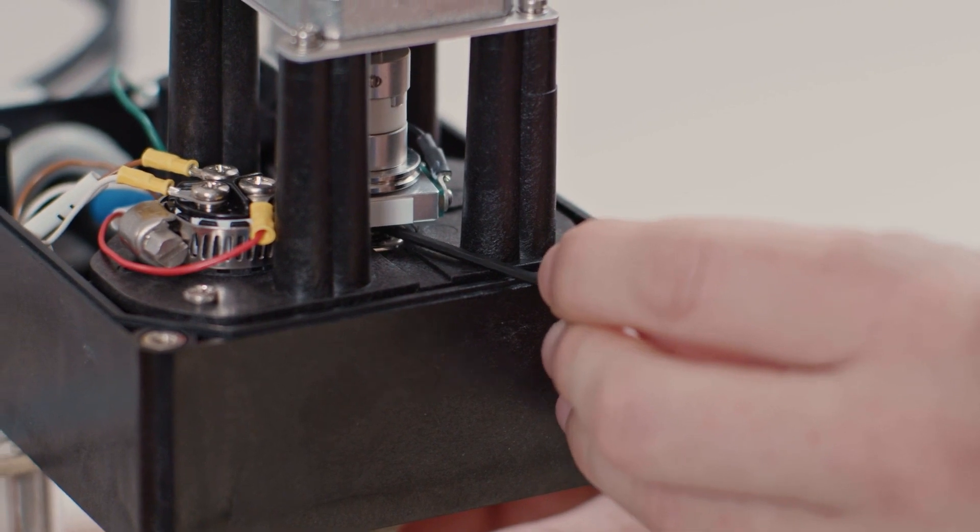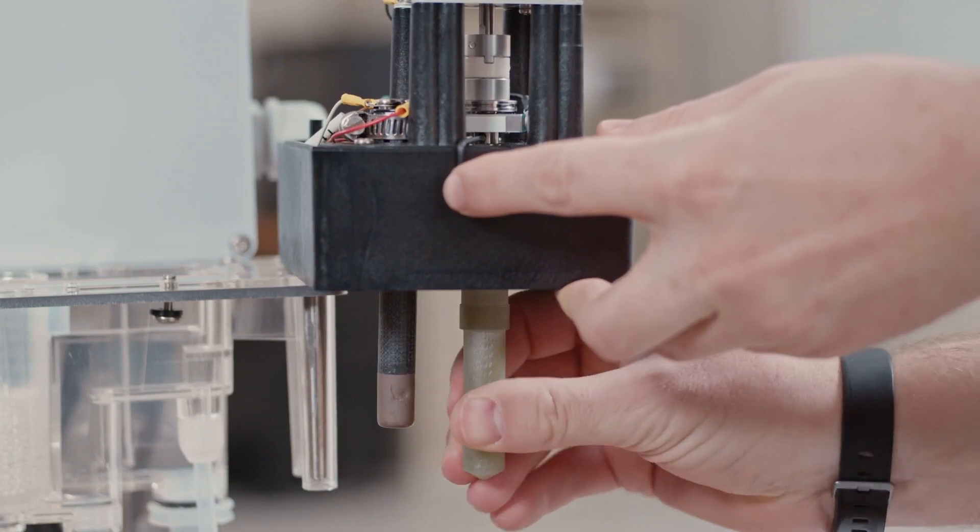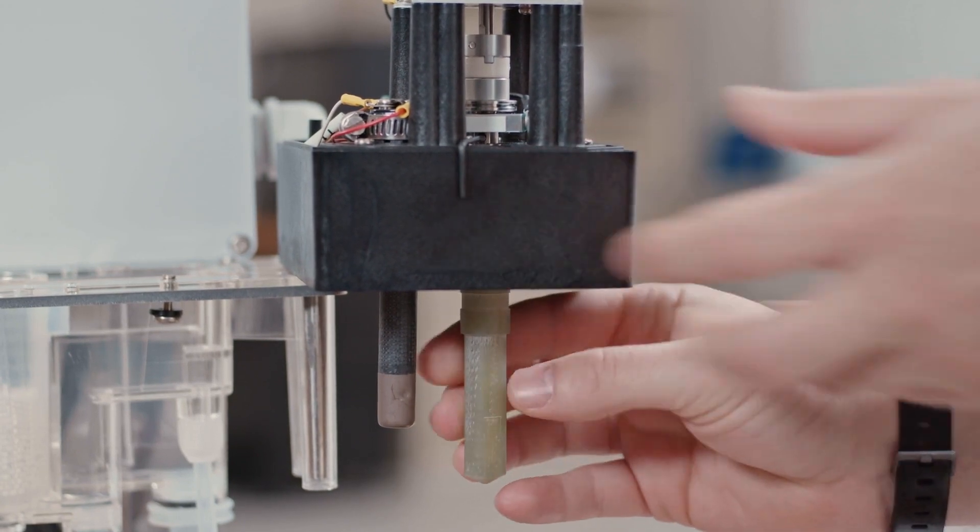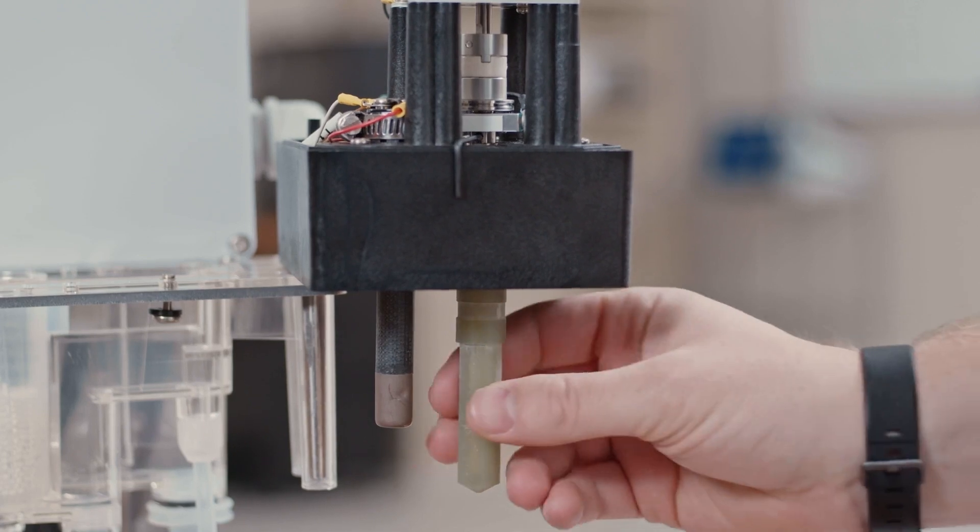To remove the electrode, stick the two millimeter Allen wrench into the hole at the base of the driveshaft. If you're loosening the electrode, you want to turn it clockwise because the electrode is a counter screw to keep from rotating itself off the driveshaft.